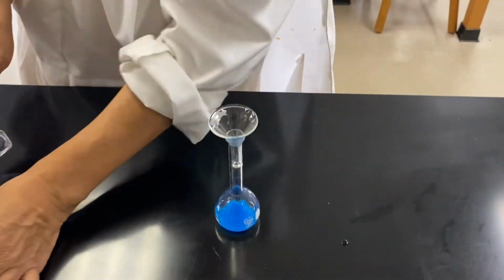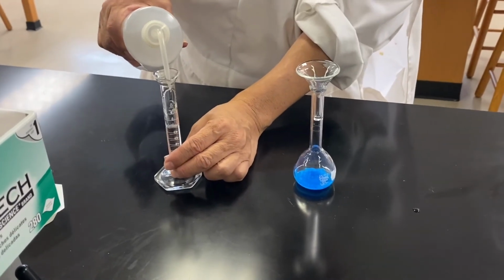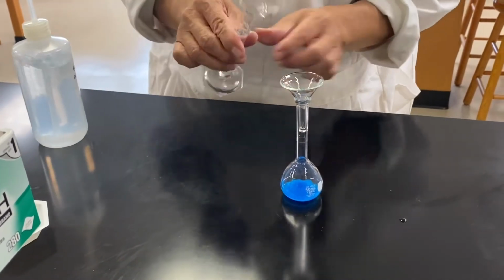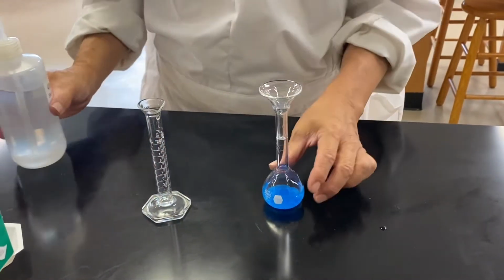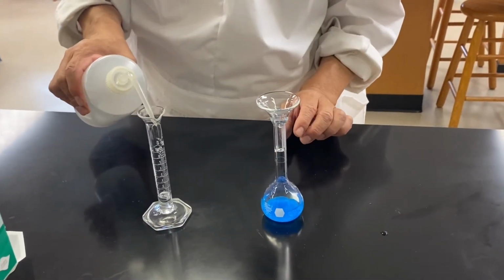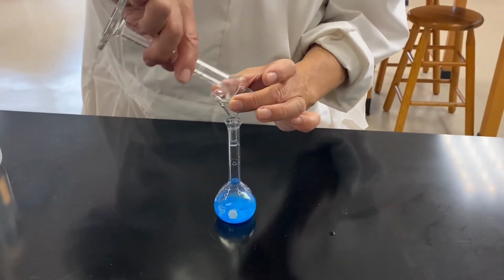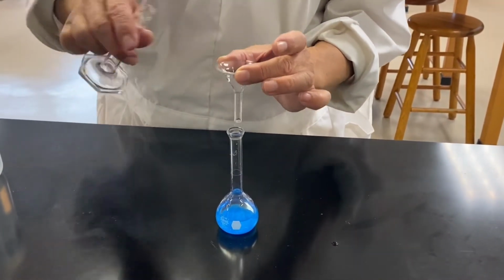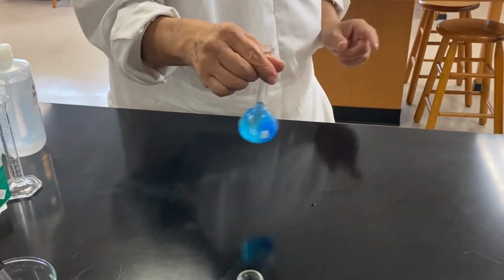So now it's 10 and another 10 and 5. Okay. Now you're going to follow your method.